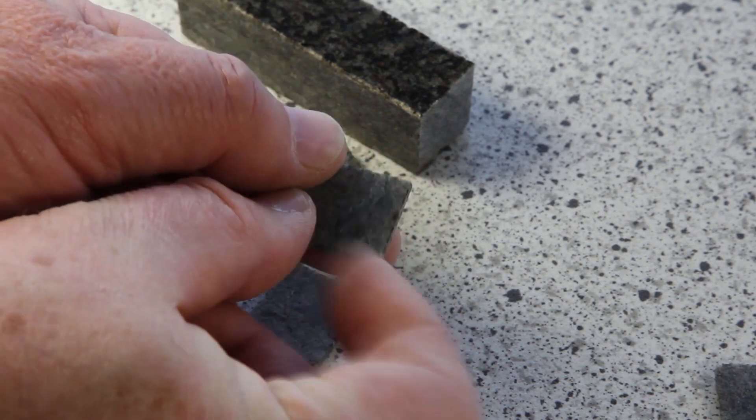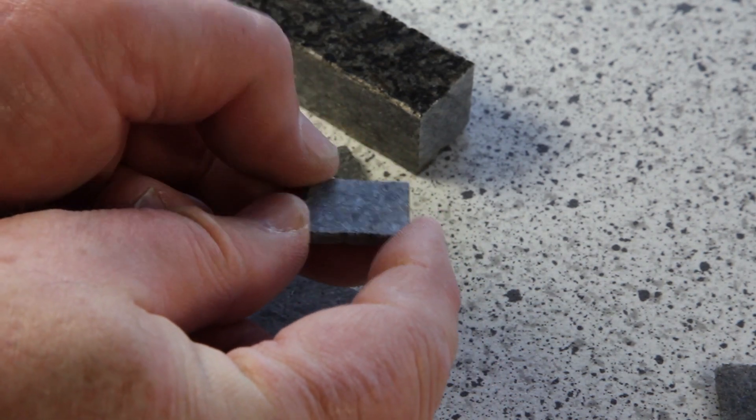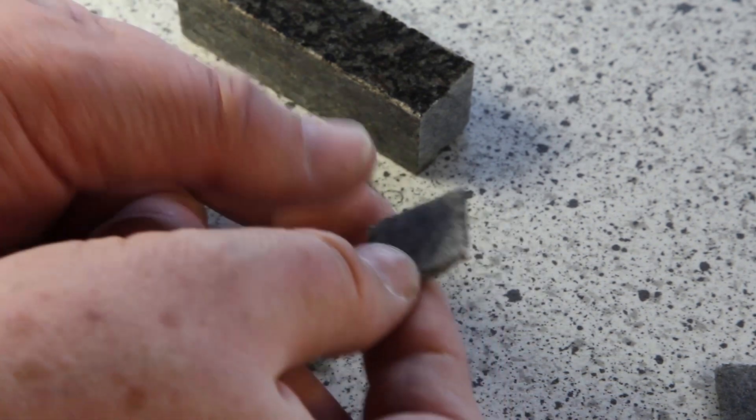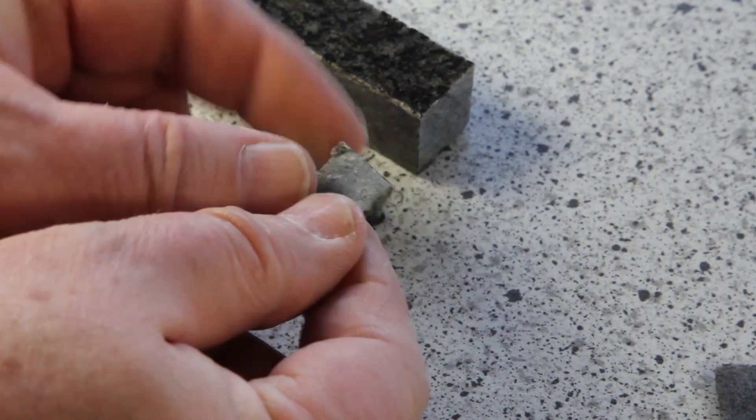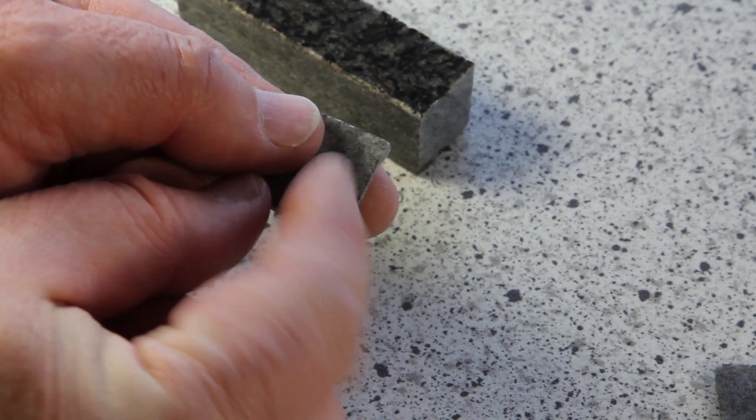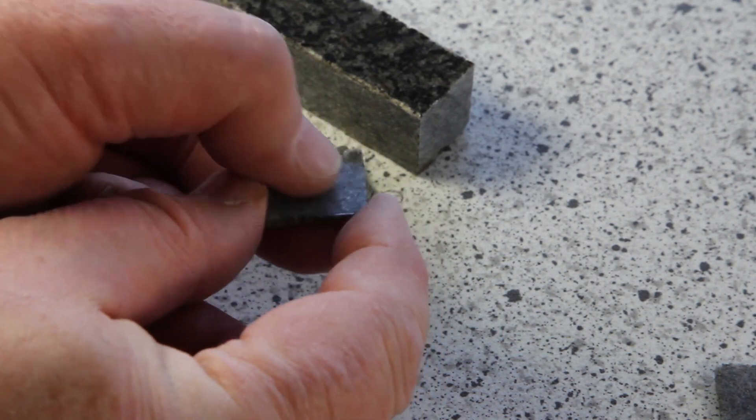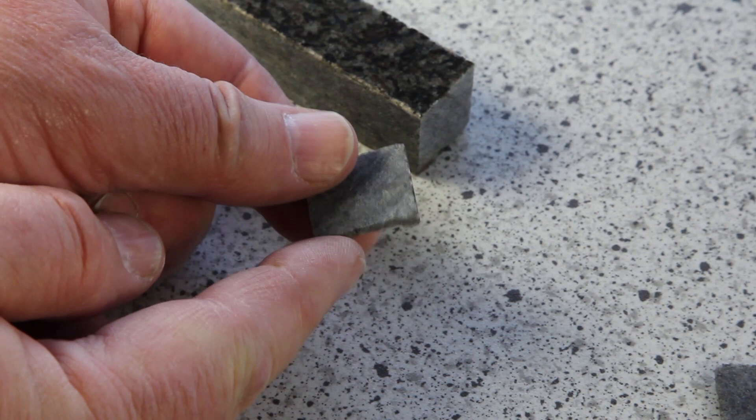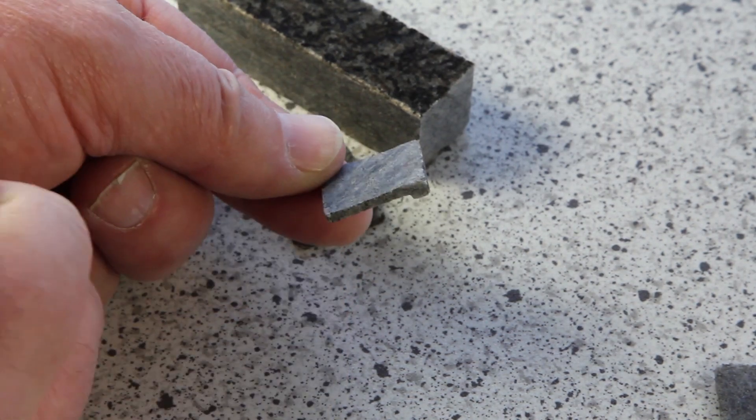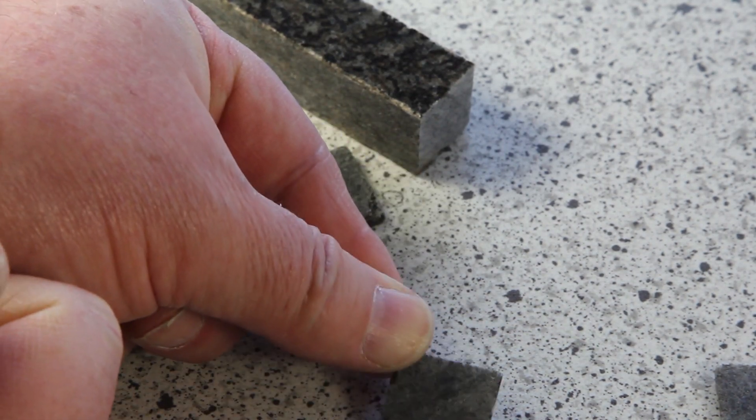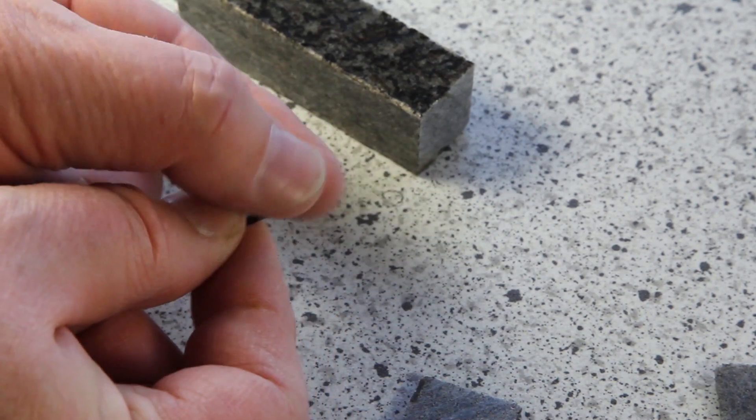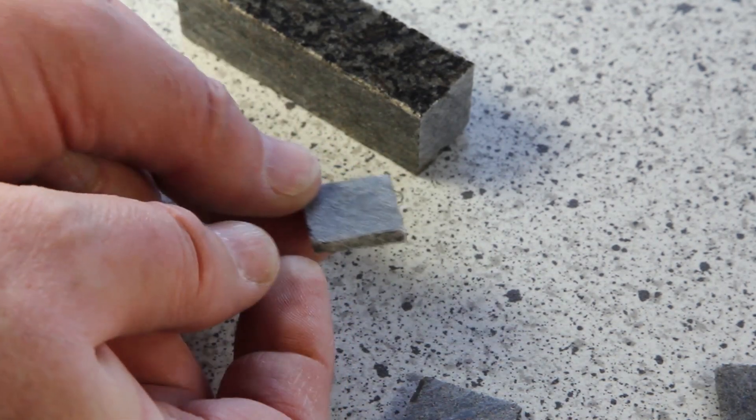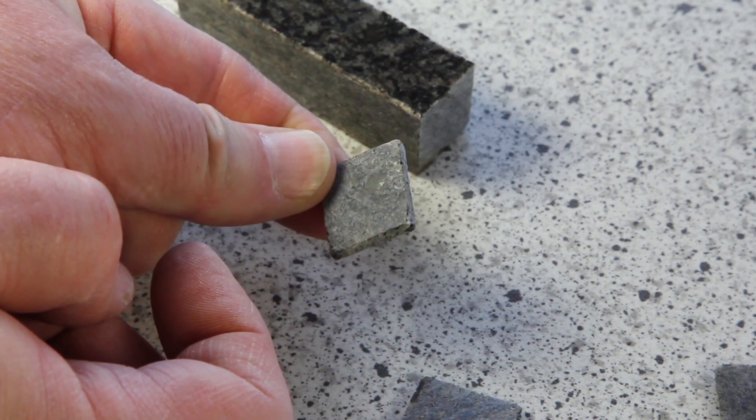This sample is flat on this side. It's okay, I can use it like this. This one has a flat side and it's not flat, so I can use the flat side to glue it on the slide here. This side is not flat, this side is good, so I can use this side.